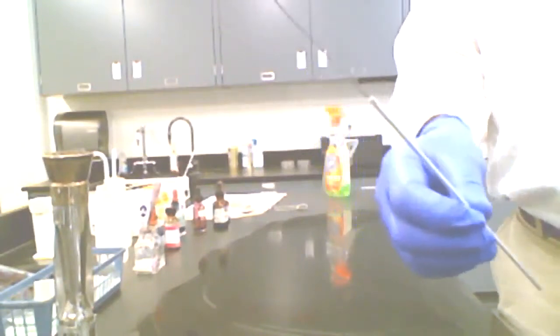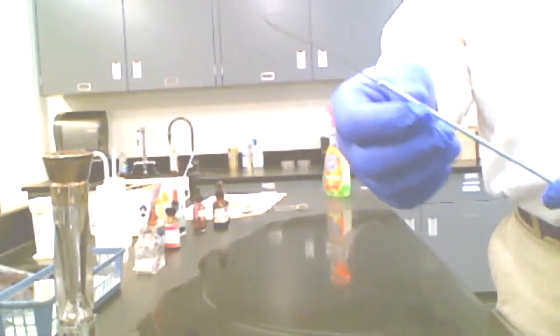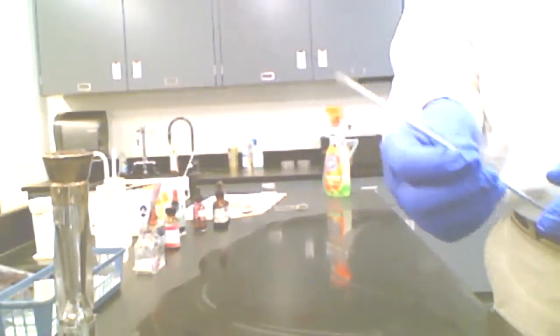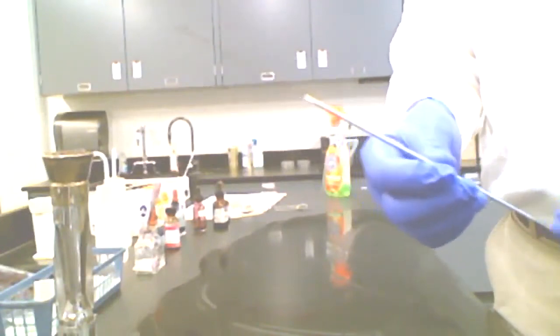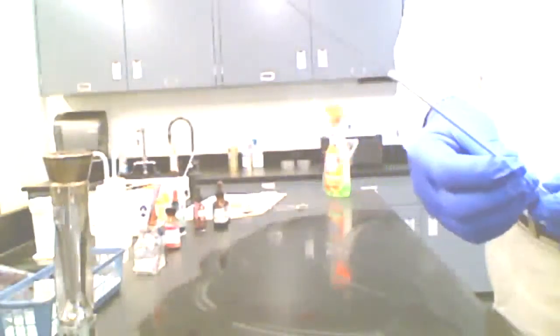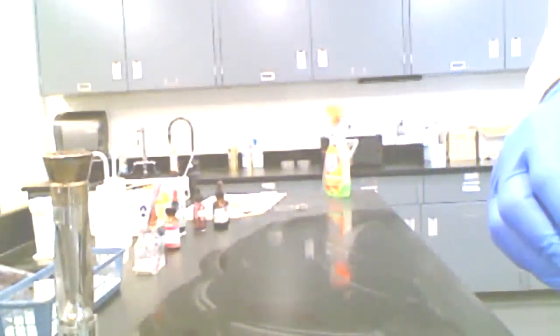I'm going to put this in a Bunsen burner flame. I'll show you how that's done. For the most part, the heat's not going to be conducted back into the handle. If I were to hold it in there extensively, that might happen. So you learn ultimately just how long this takes, and you avoid that sort of thing. But let me go ahead and light the burner. I'm going to turn on the gas.